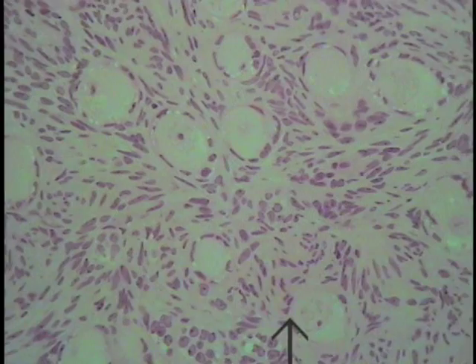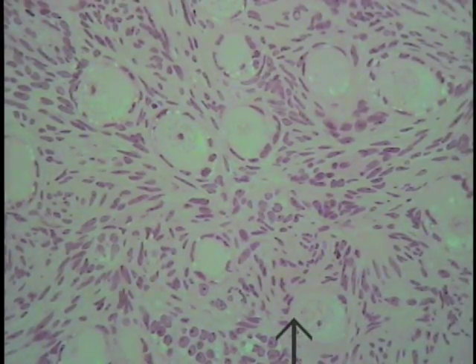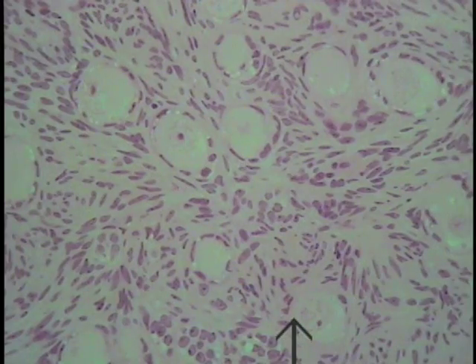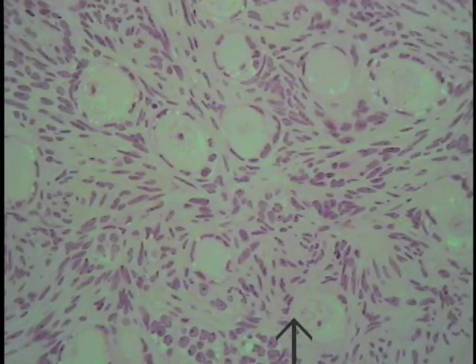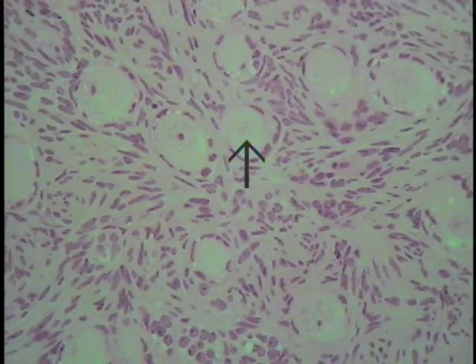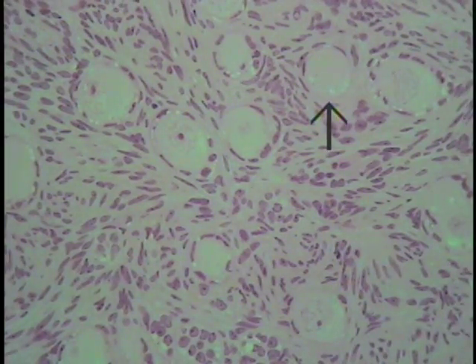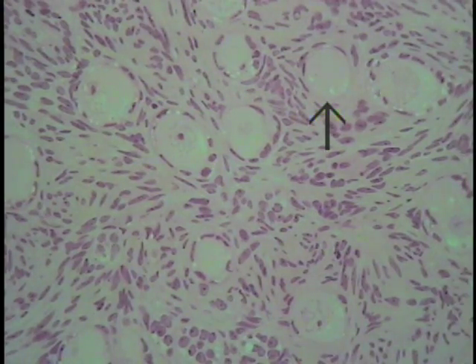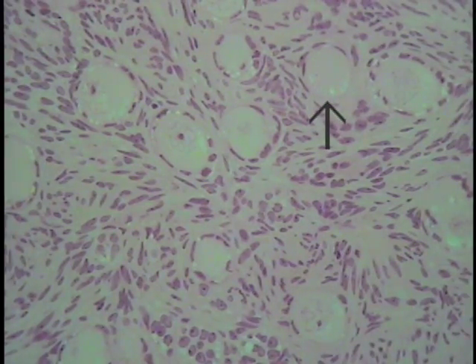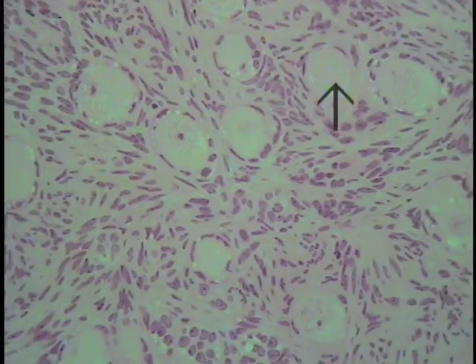This dense round structure within the center of the nucleus actually represents the nucleolus. Similar structures can be demonstrated in this particular ovum as indicated by the pointer. Not all of the ova show a nucleus or a nucleolus — in this particular case we only have a grazing section to the nucleus, and in this section of this oocyte the nucleus is absent from the field of view because these cells are so large and spherical that a section may pass on either side of the nucleus, making it not visible in a two-dimensional section.